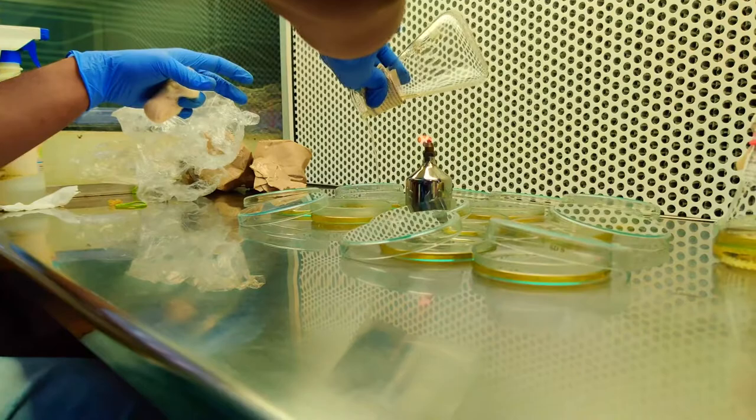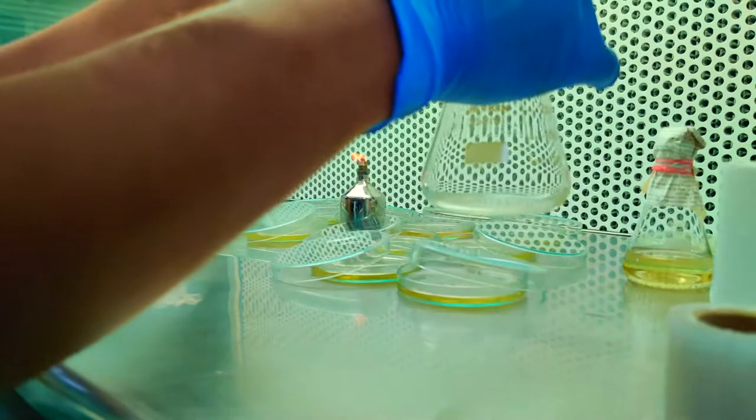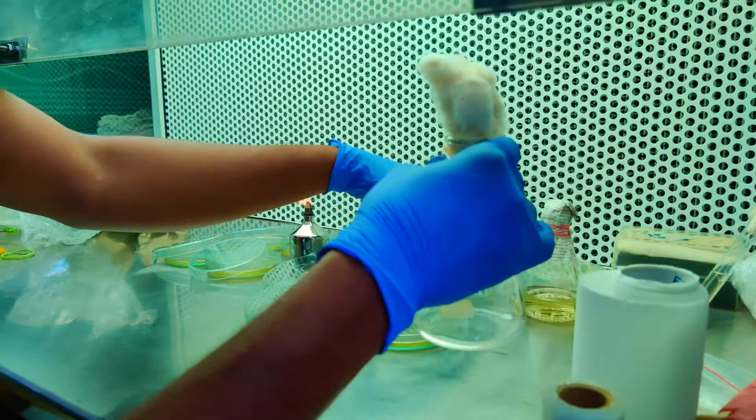After pouring off, you just keep a bit of the plate open so that any water vapors will come out. Those water vapors will not cause any contaminations.